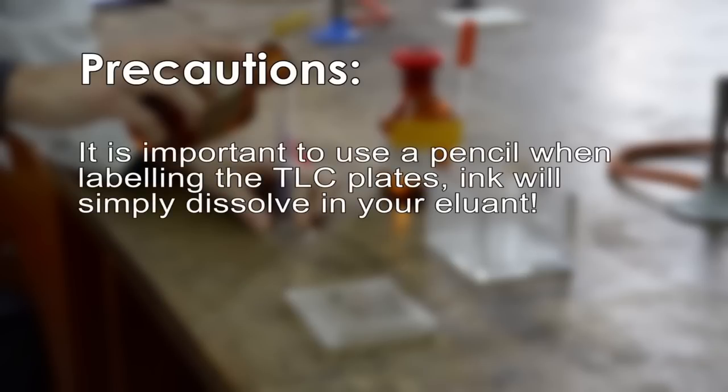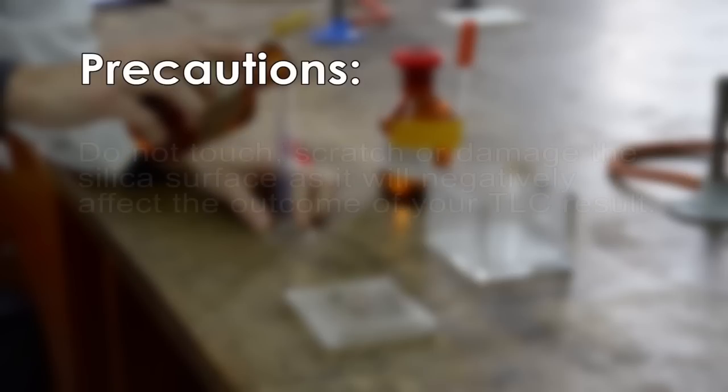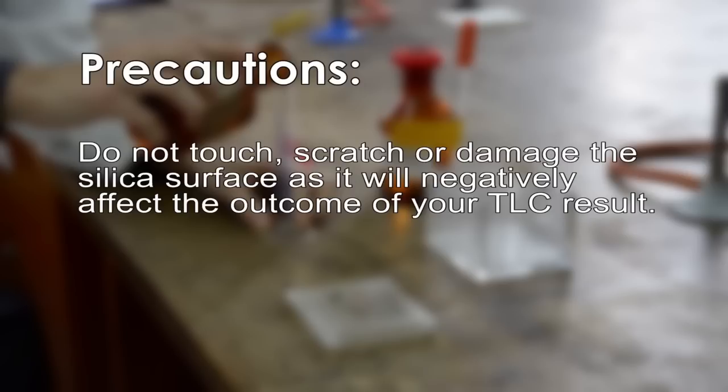It is important to use a pencil when labeling the TLC plates. Ink will simply dissolve in your eluent. Do not touch, scratch, or damage the silica surface, as it will negatively affect the outcome of your TLC result.